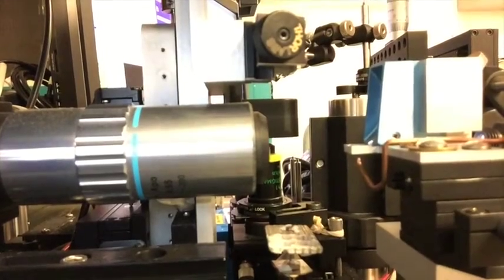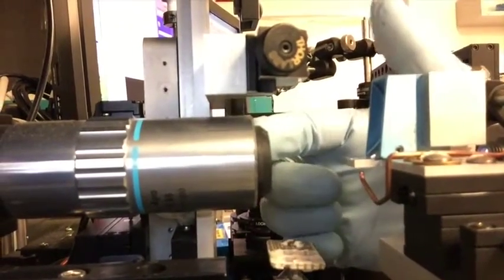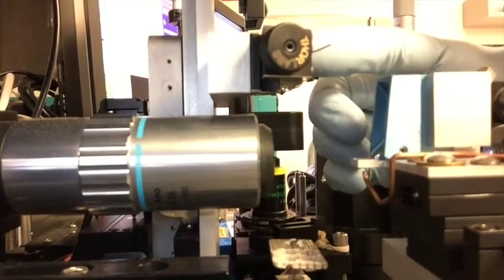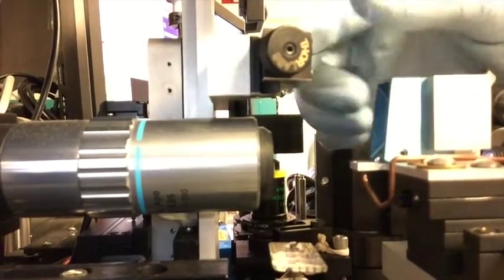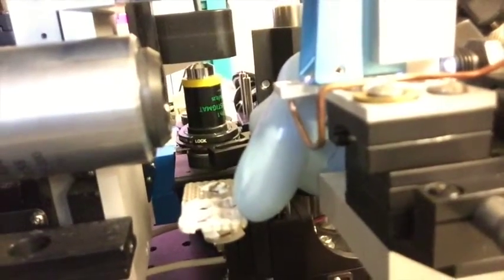who glues them. So here is a side view of the major parts of the dipping clipping apparatus. This is the camera right here. This is the cutter. This is the clamp that holds the tip. You can see them, especially my gloves there. This is a little wire that holds it in. A little bit farther down here, this is the holder for the gold or polylysine.